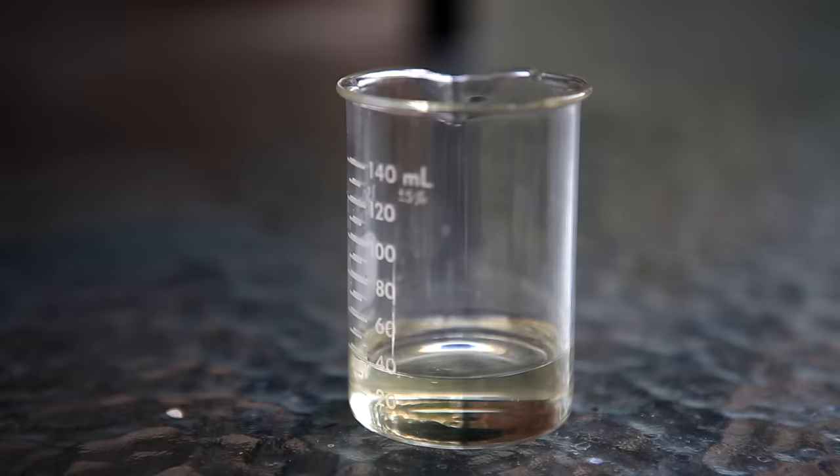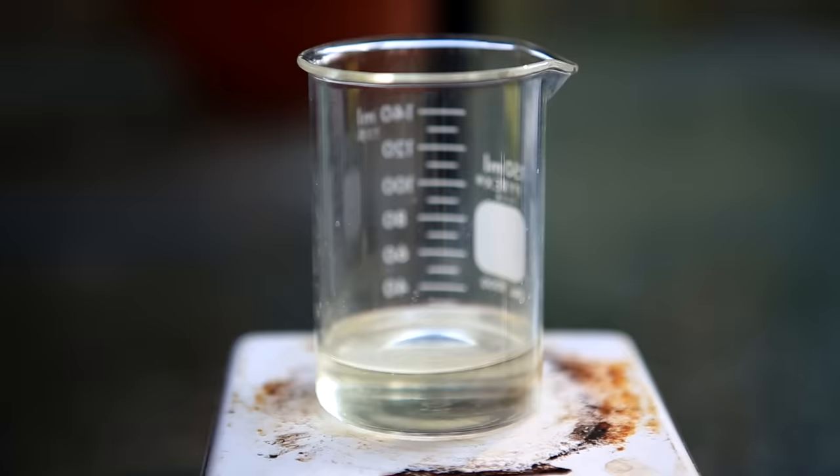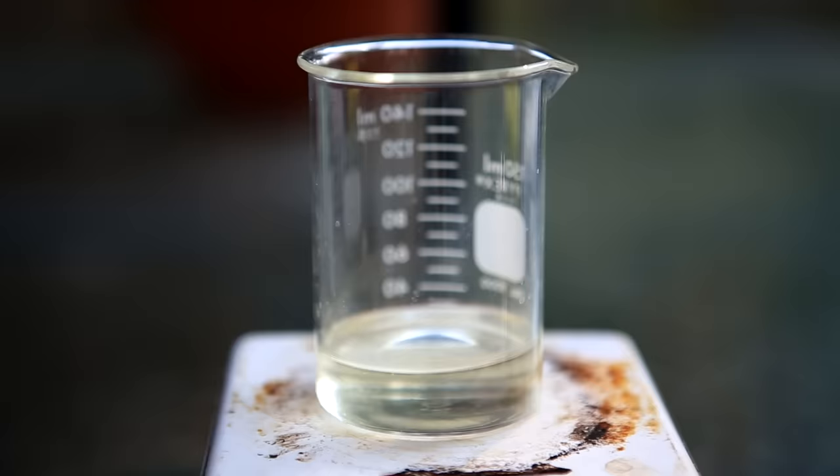Even though it looks pretty clear, there will still be a little bit of water in it. So to fix this we usually add some drying agent, and in my case I'm just using some molecular sieves. After drying for 20 minutes, it's then decanted to a clean beaker. The sieves are left behind but they're first washed with a little bit of dichloromethane.